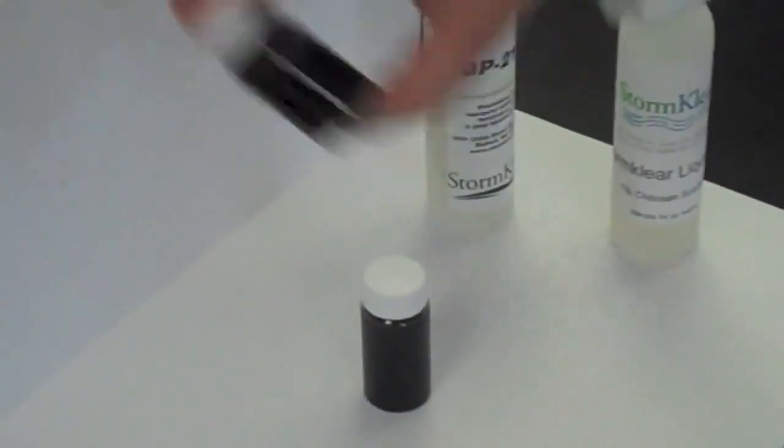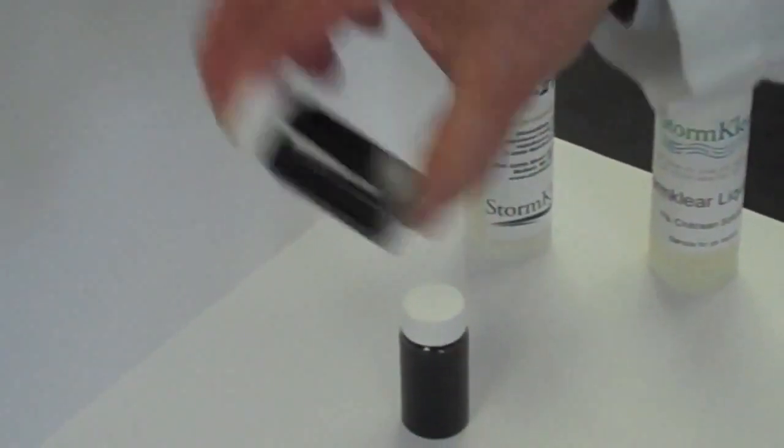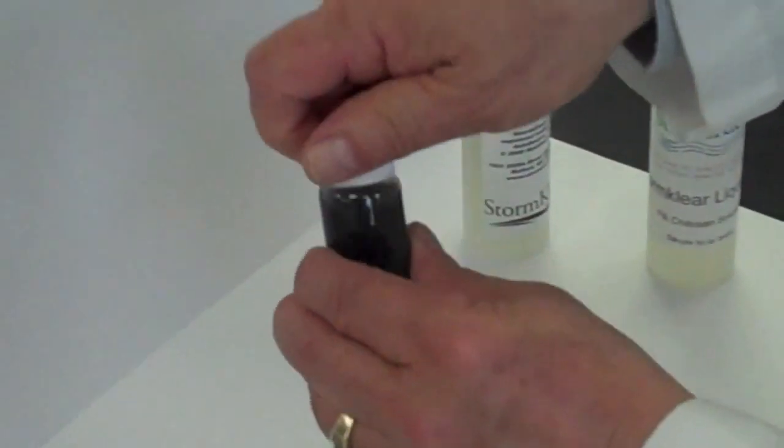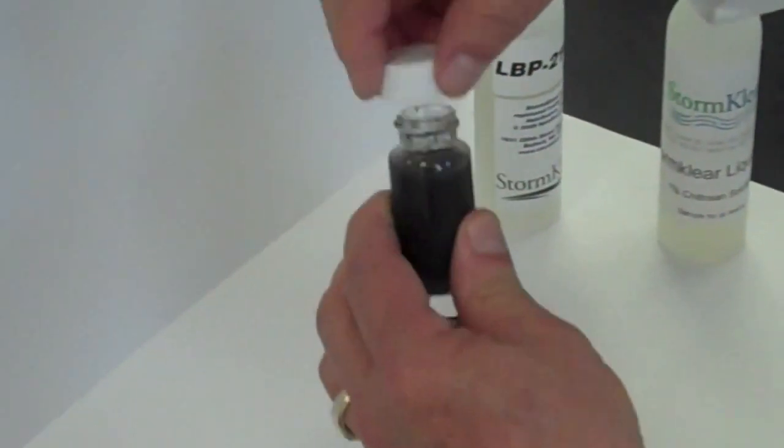and allow that polymer to interact with the suspended hydrocarbons and microorganisms in this water.